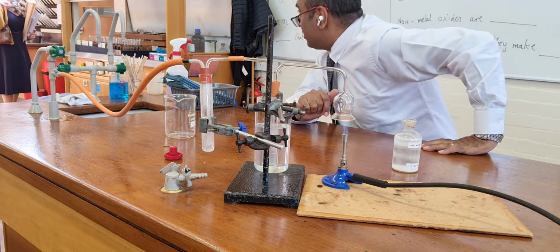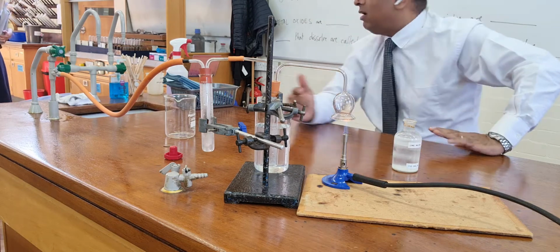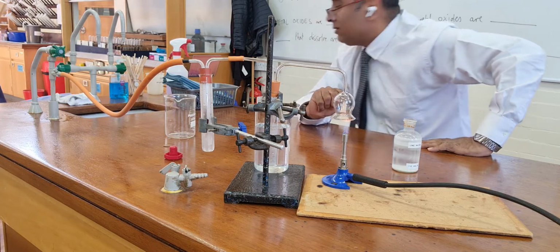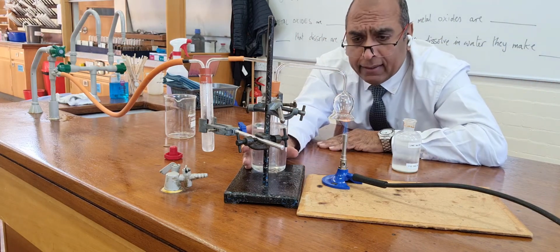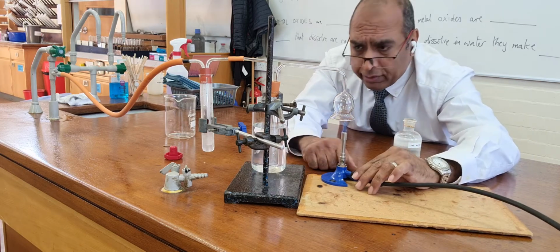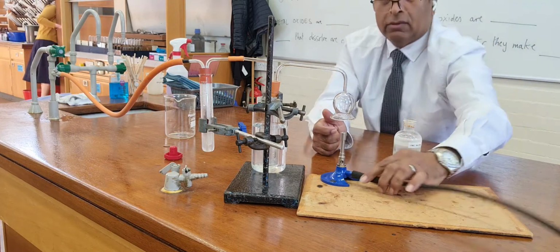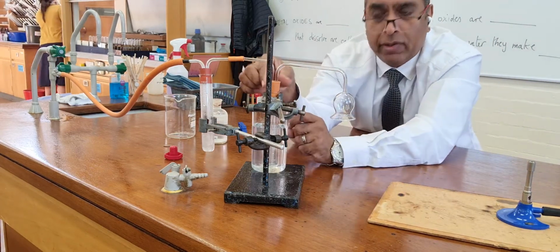Are you in there next? Yeah, I'm only here 2 more minutes. So I've got this beaker here, and I can stop the experiment and show you, which I'm going to do. Sorry, a colleague of mine has come in, wants to use the room.